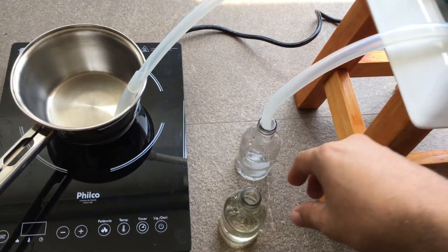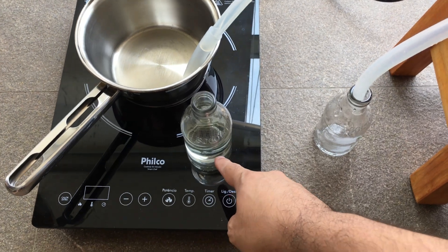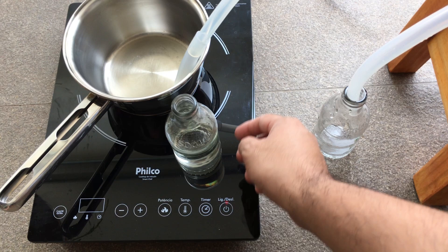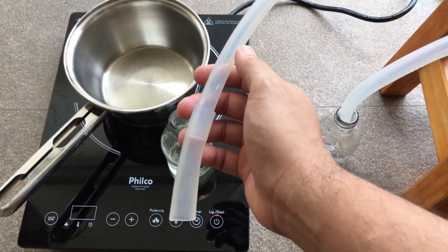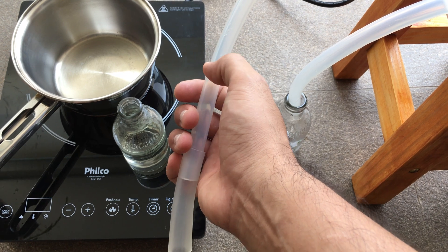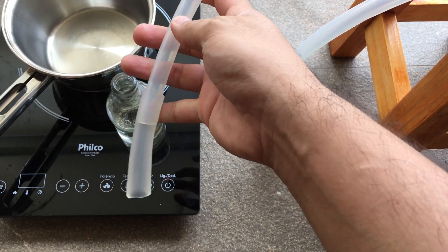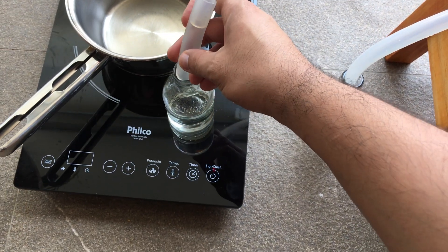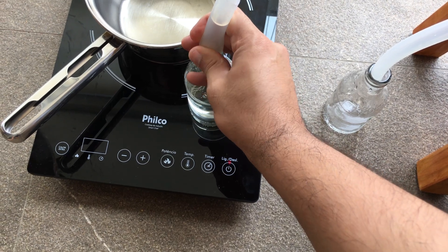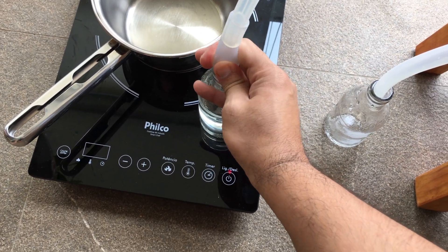Here's the setup — it's a very simple distillation. Here's the glass container with the crude ethyl acetate. This is food-grade silicone tubing from a brewery. You want this to be as tight as possible for there to be minimal leakage of the solvent once it's heated.